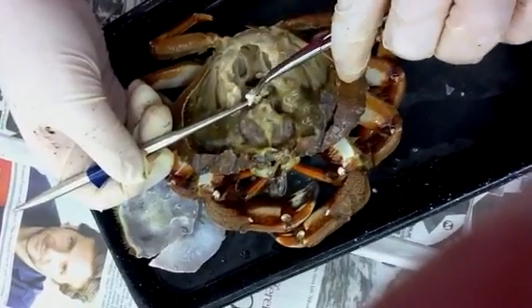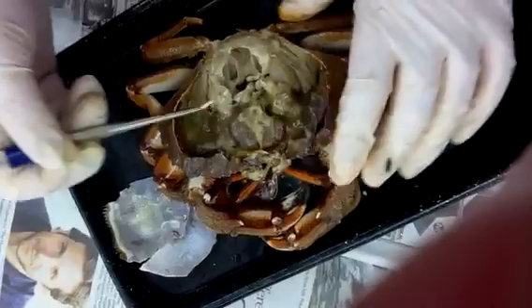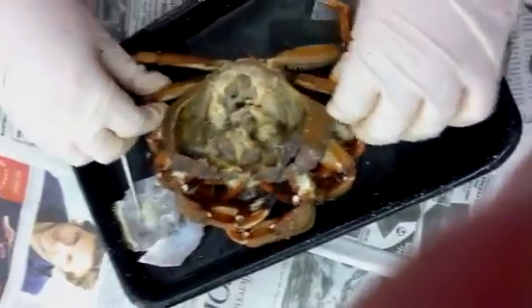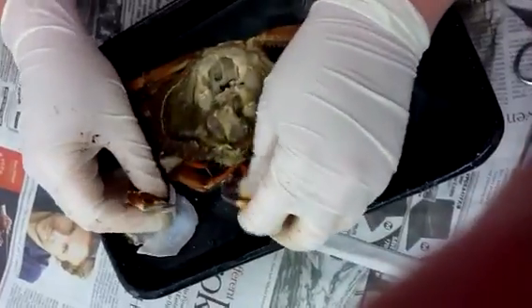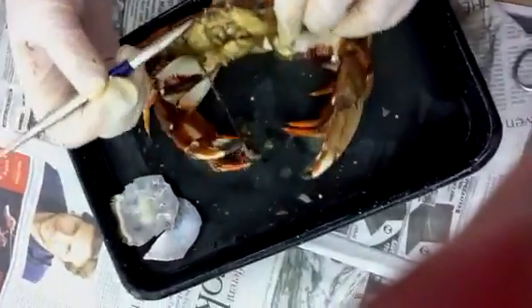It's all compressed because when we cut into it, we exsanguinated the animal. You can see the animal has walking feet — there are these here — and it also has claws for grabbing its prey. It has two eyes.